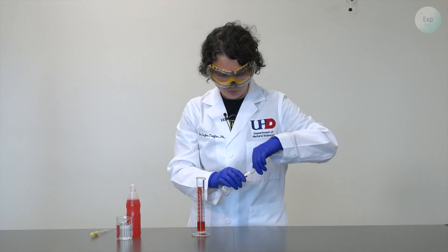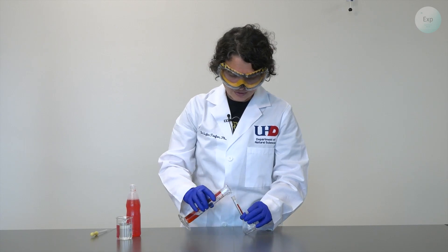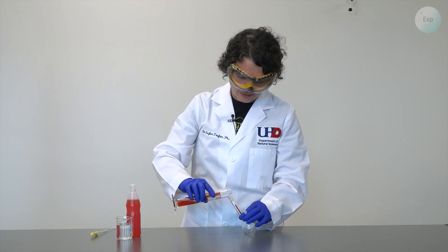So next I am going to open up my volumetric flask and transfer my juice concentrate into it.